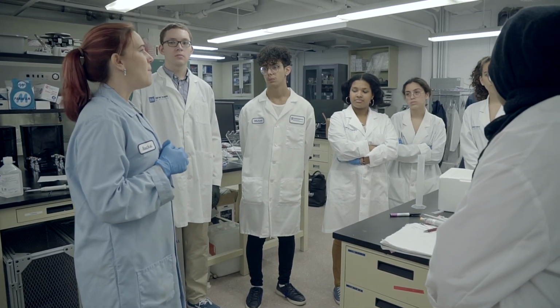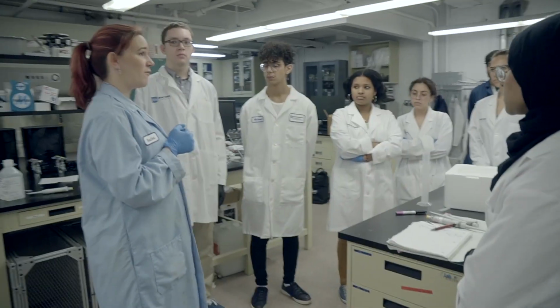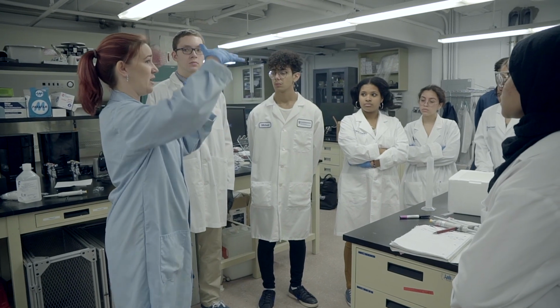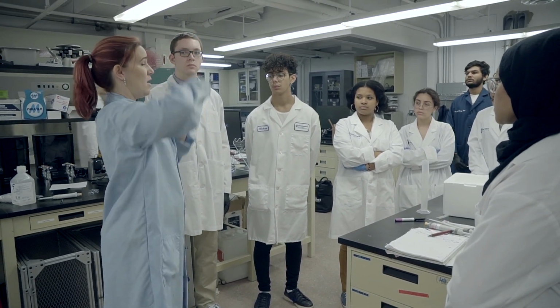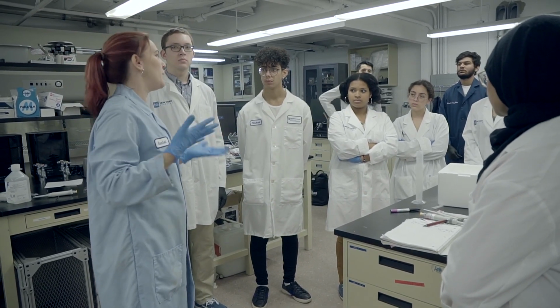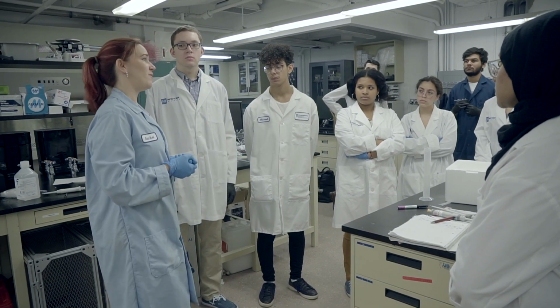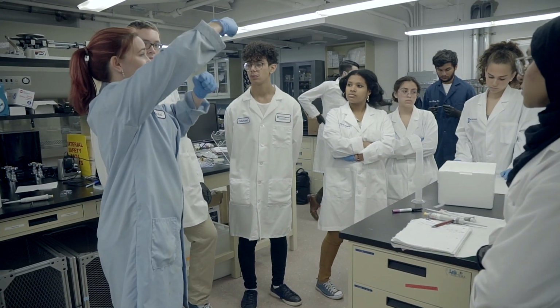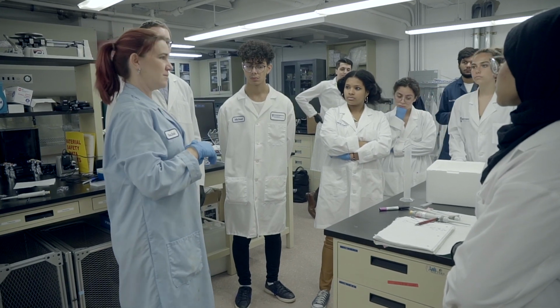So if you have a band that you're expecting to be 5,000 and another you're expecting to be 4,500, you might want a 1% gel or a 0.5% gel so they can separate out from each other and you get more resolution. So you can really see them separate. Or if you did them in a 4% gel, they'd both be stuck at the top and you wouldn't be able to see what it was like. But if you have a band that's 200 and a band that's 500, you want a higher percent gel with smaller pores, because the 500 and the 200 will have different difficulties getting through the gel. Does that make sense? Great.